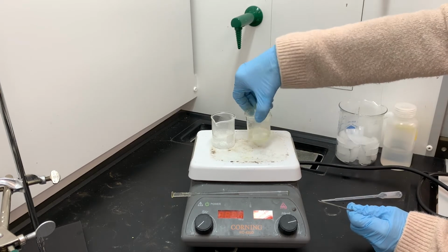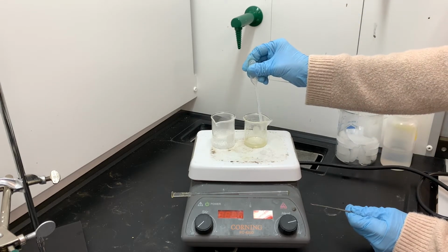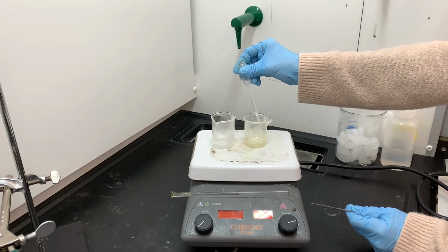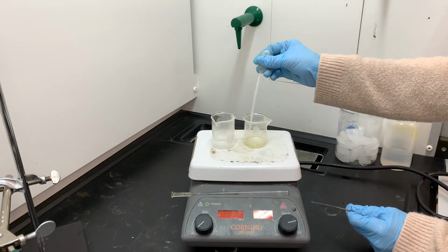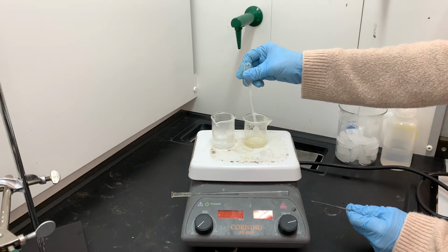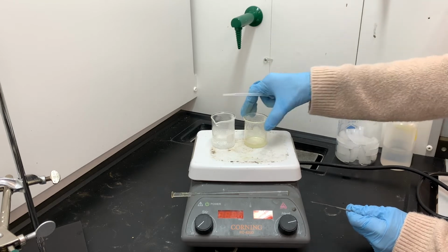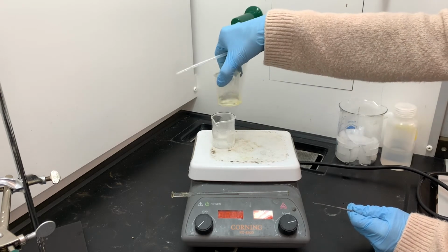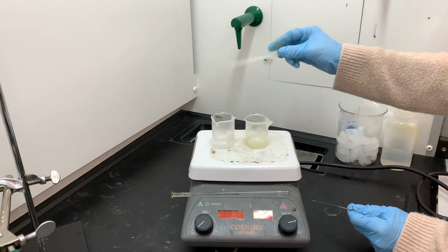Like I've done a really good job of scraping everything down into the water and getting everything rinsed. Using the pipette to help further rinse stuff down inside the beaker. What I'm doing here by reusing that solution is a way of helping to clean the inside of the beaker without adding additional water.